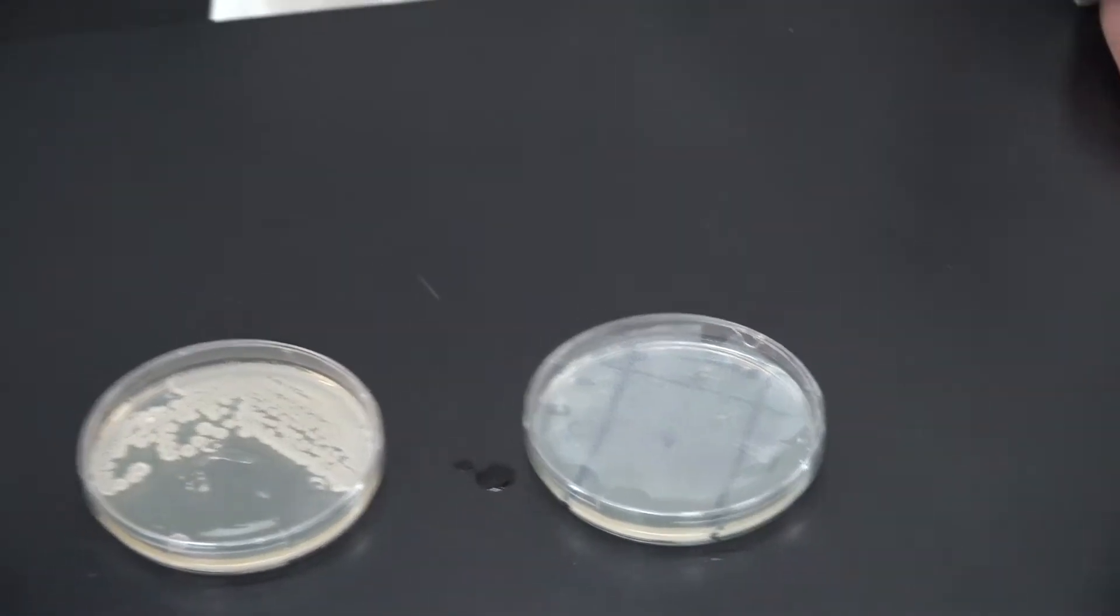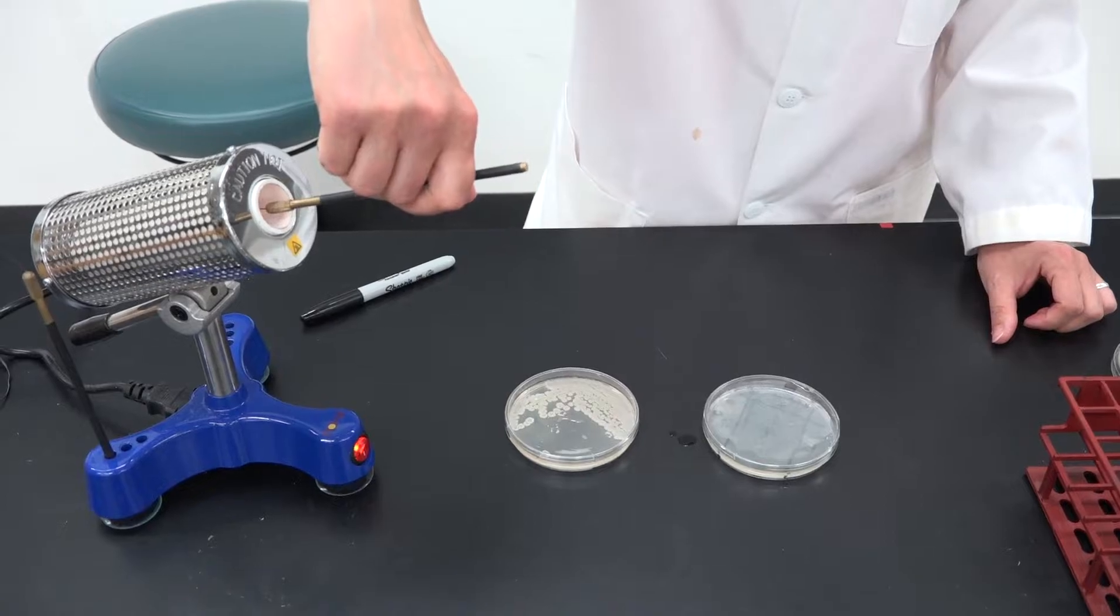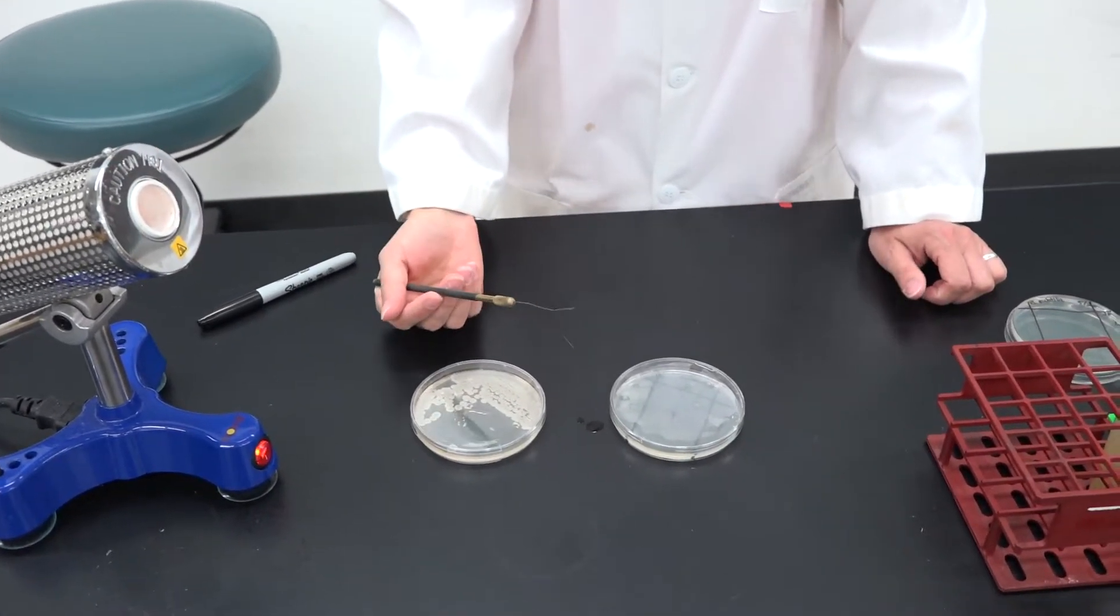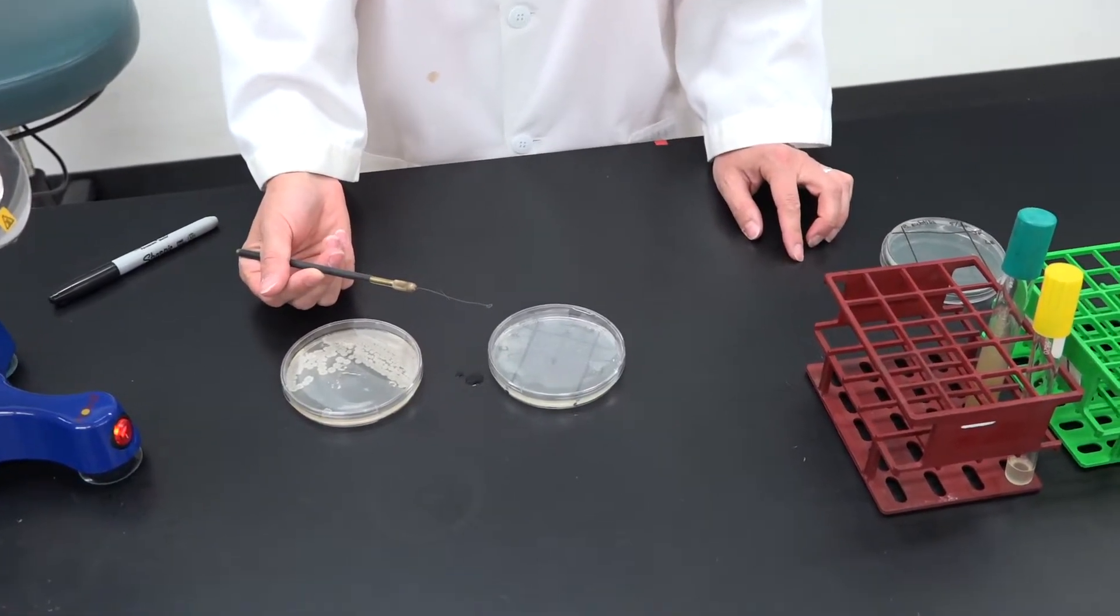Then you need to re-sterilize your loop. Remember to let it cool for a few seconds before you touch the plate, otherwise you'll sizzle the bacteria.